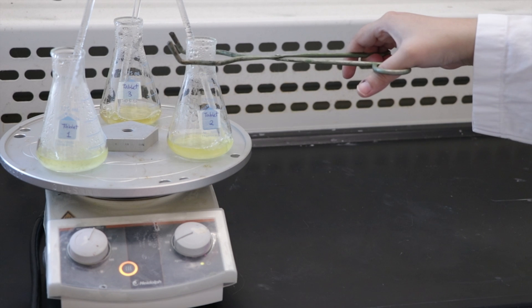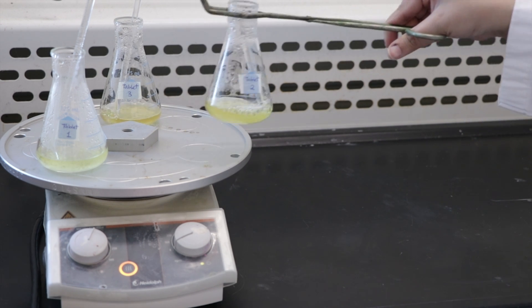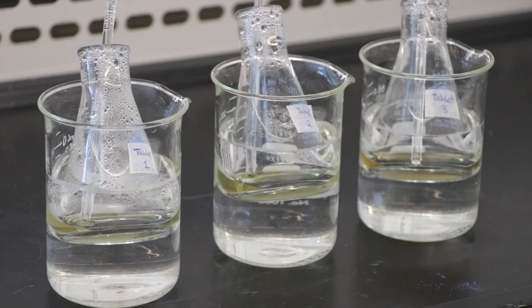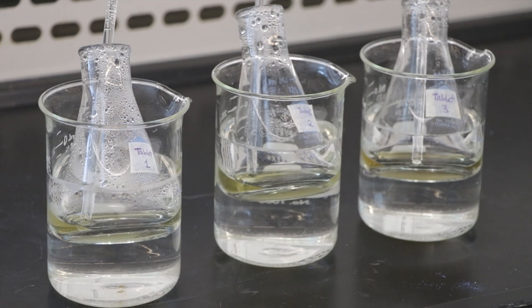Once the solutions come to a boil, remove them from the hot plate and allow to cool to room temperature. Placing the flasks in beakers of tap water will help speed up the cooling process.